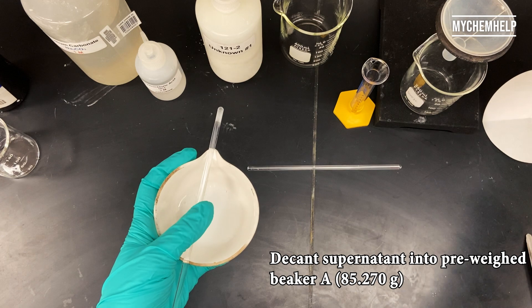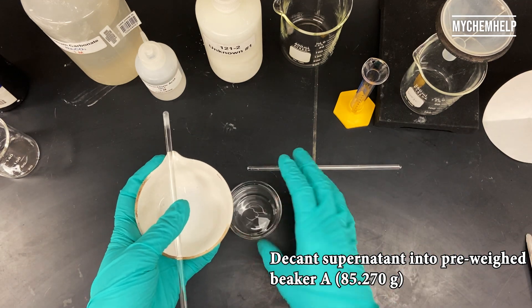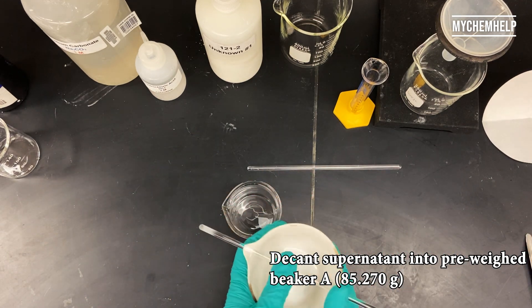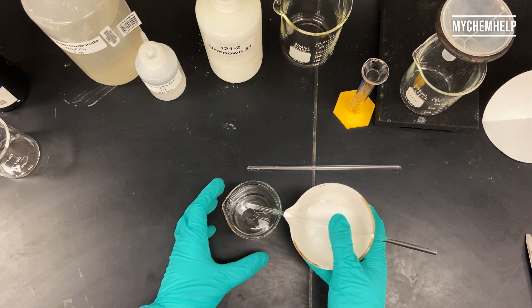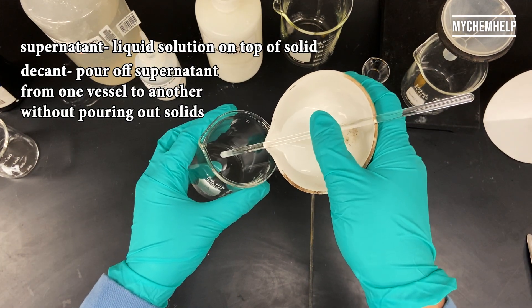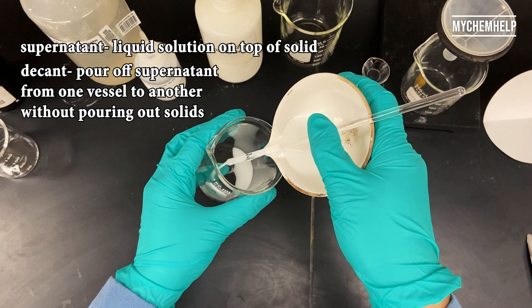All right, and now I'm ready to pour off that supernatant into a pre-weighed beaker. And there's some of those definitions for you guys up at the top.